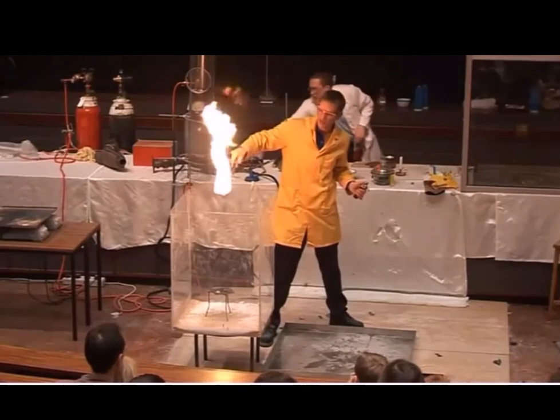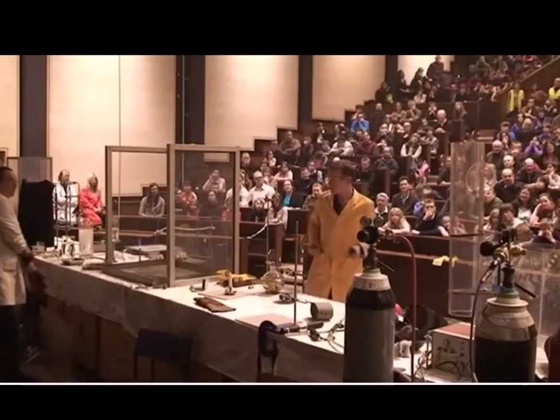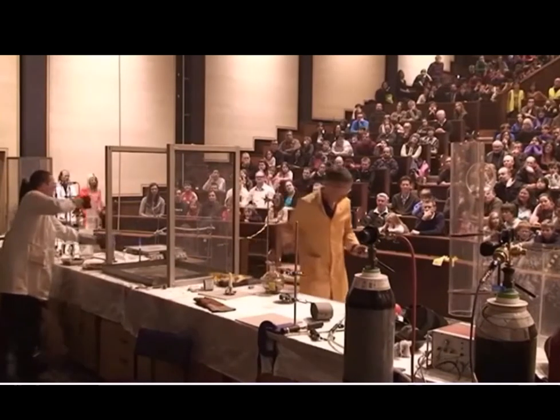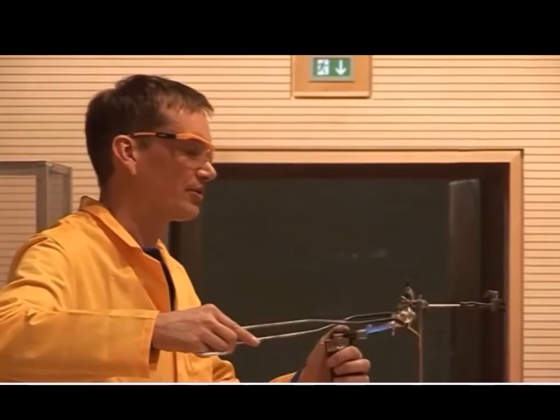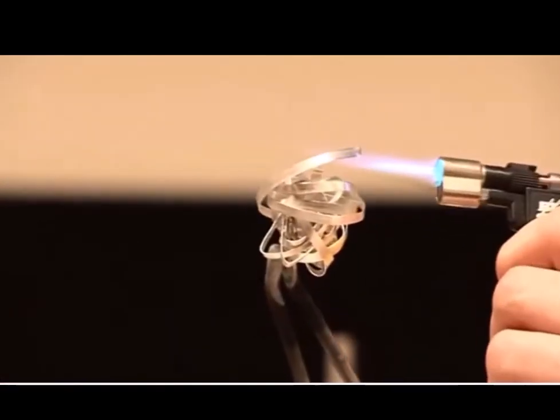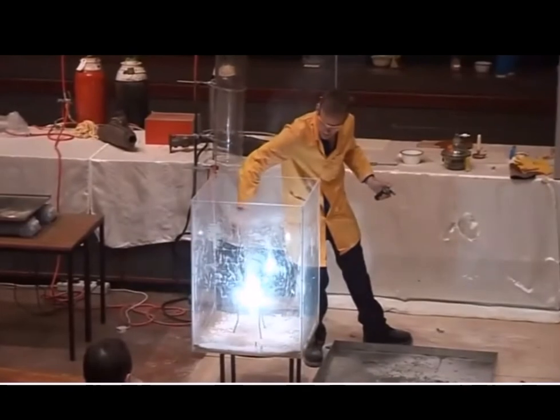He quite likes that demonstration, so he's done it two or three times just to prove it. So the big box is basically filled with carbon dioxide. Now, he's going to show in a moment, he takes a roll of magnesium and he sets it alight. Now, when that goes into the carbon dioxide, you will get an actual reaction this time. So the magnesium is more reactive than the carbon, so it can steal oxygen away from it. So there's the roll of magnesium. And then what we'll get is magnesium and carbon dioxide, giving us magnesium oxide plus carbon.